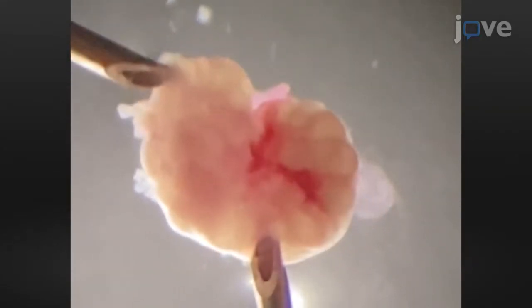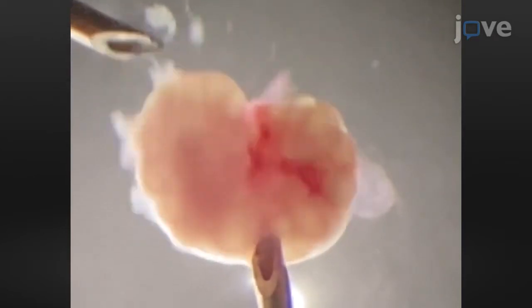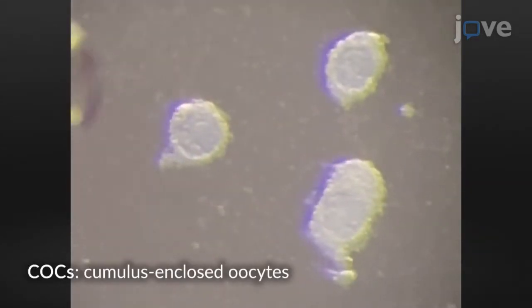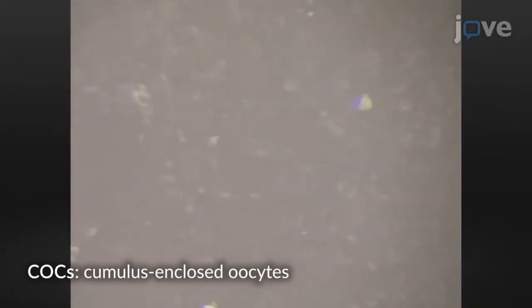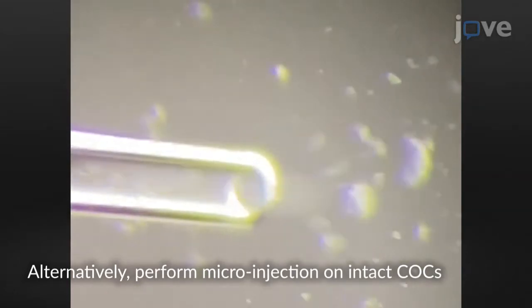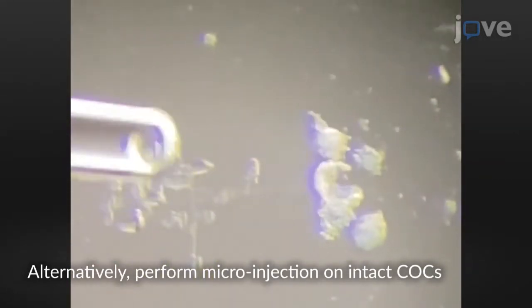To begin, carefully open the antral follicles by making a small cut in the follicle wall with a 26-gauge needle. Isolate intact COCs with several layers of cumulus cells using a mouth-operated glass pipette. Use a smaller pipette and mechanically denude the COCs by repeated pipetting.